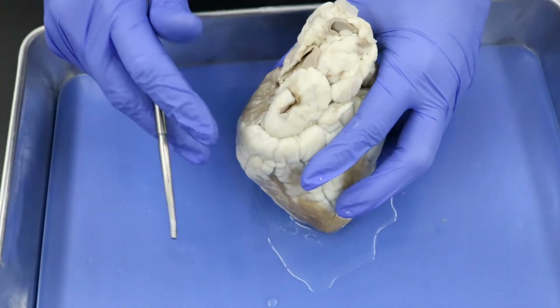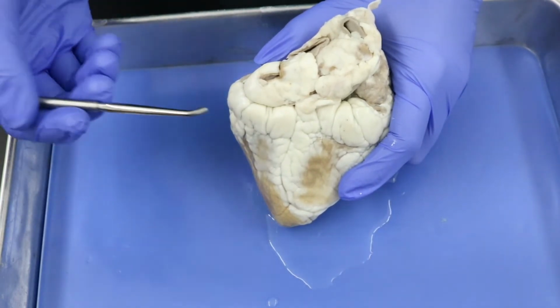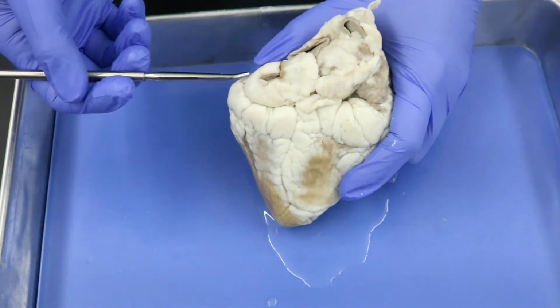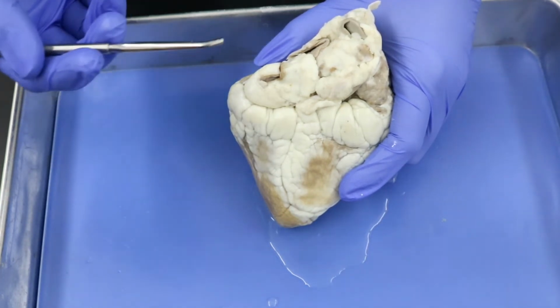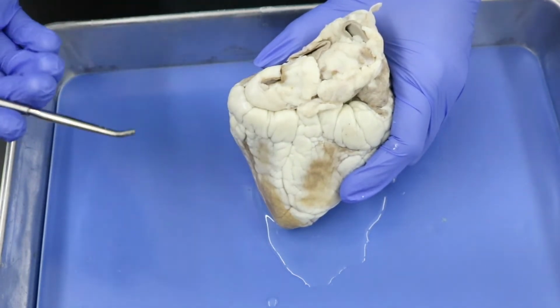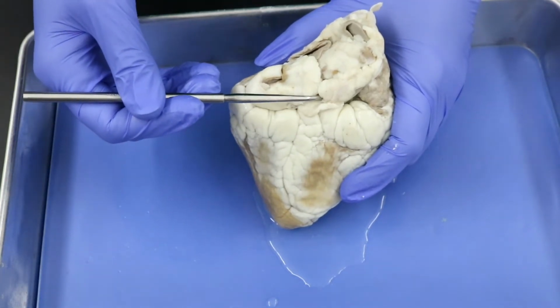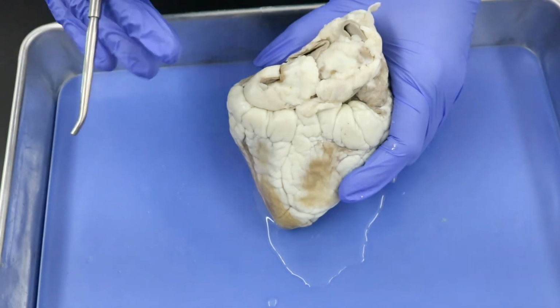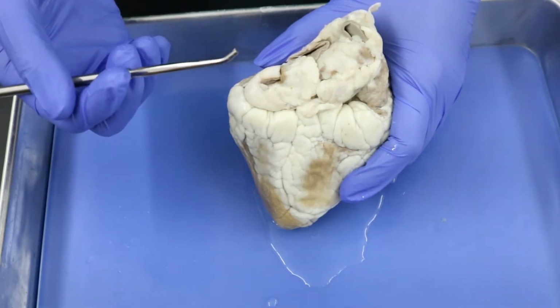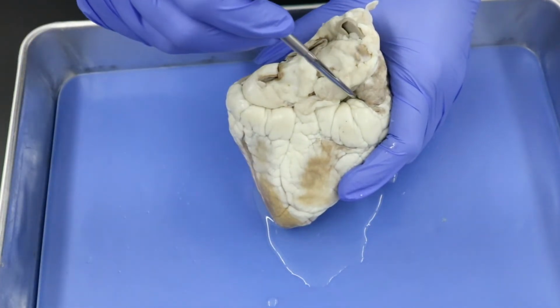Now, turning around to the posterior aspect, there's two other structures we kind of want to look at over here. So we've already said this line in here is part of our coronary sulcus. Remember, a sulcus is the space. Running inside the space is going to be coronary vessels of one type or another. And in here, we're going to find our coronary sinus. Now, a sinus is a very large collection of veins, and in this case, the coronary sinus returns the coronary blood to our right atrium. Since we're on the posterior side, that's going to be over here.